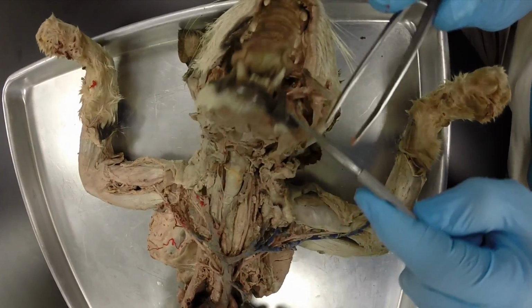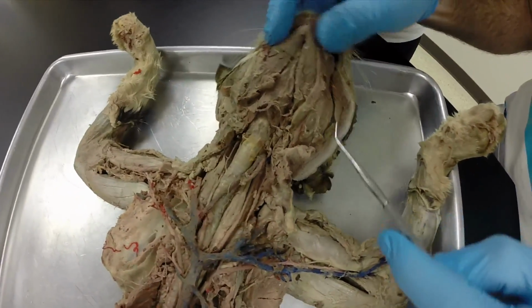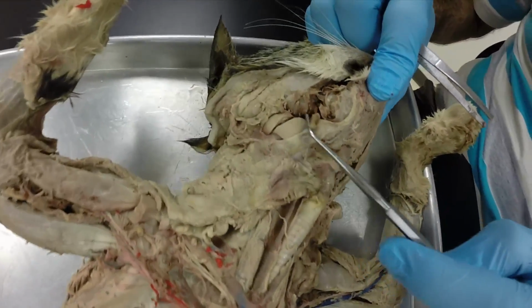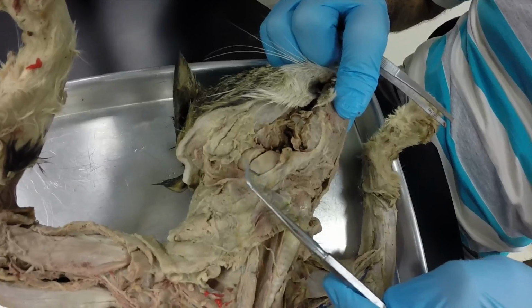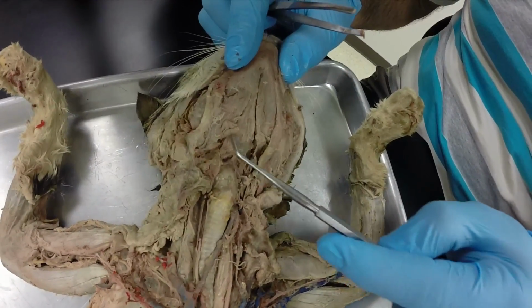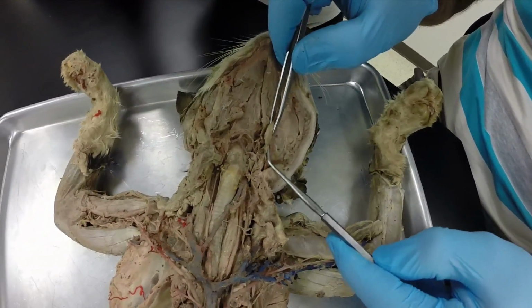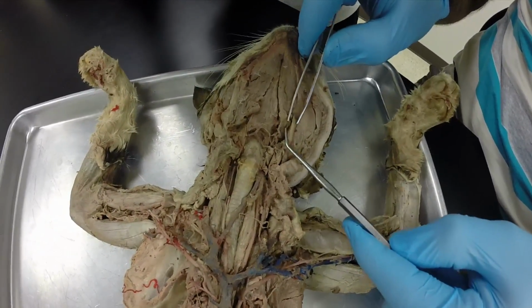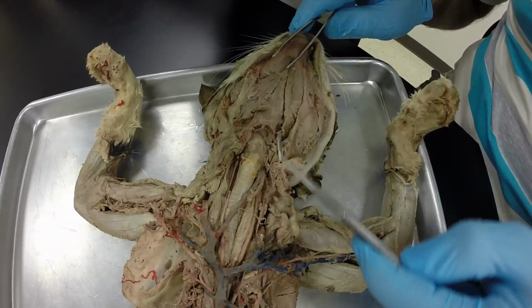So if I flip this jaw back, next you can see the parotid salivary gland, which is right here. And the parotid salivary gland is the larger one. It's pretty much at the base of the ear. And then if we come down on the base of the jaw, we have our submandibular salivary glands right there. There's your left one, the right one, I don't really see it in there.